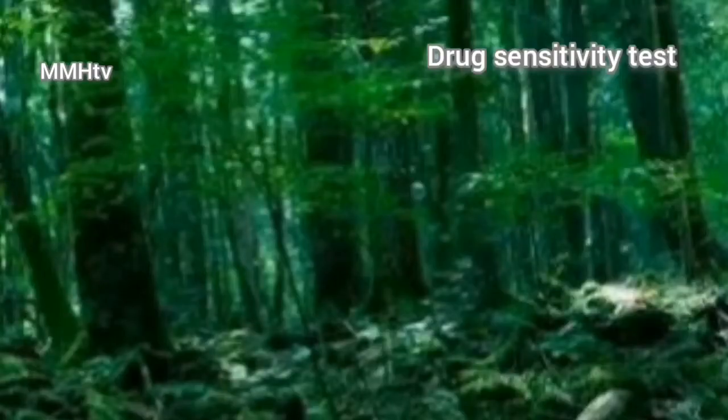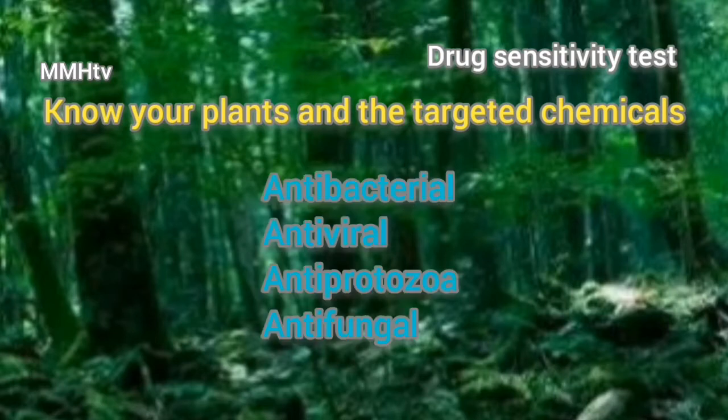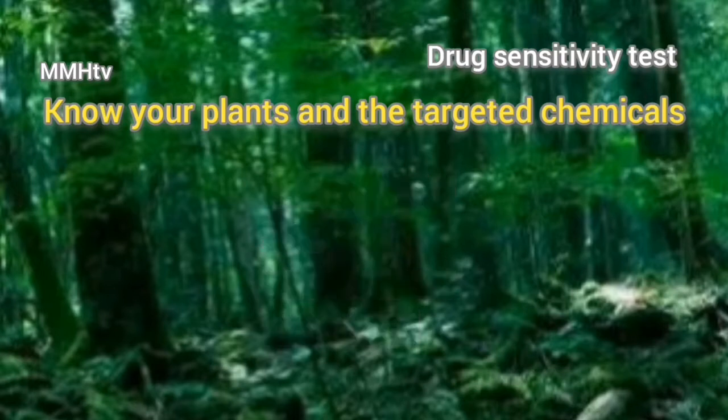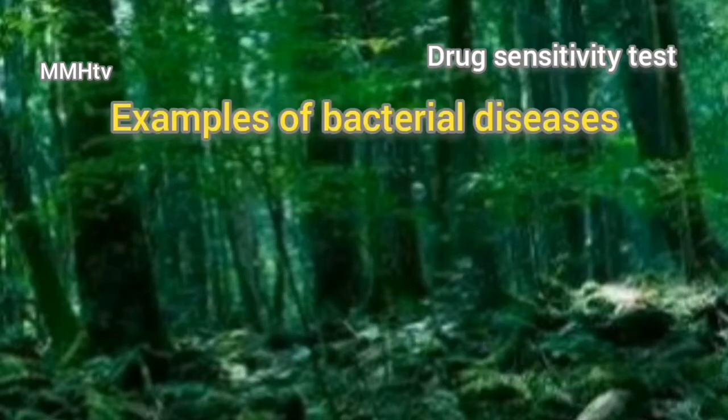Before you start a drug sensitivity test, you must know your drug source well. In pharmacognosy, you must know your plants and the targeted chemicals in those plants. Certain plants have antibacterial properties, others have antiviral properties, while others have antiprotozoal properties, and still others have antifungal properties. Today I'm going to show you how to test plants that have antibacterial properties.